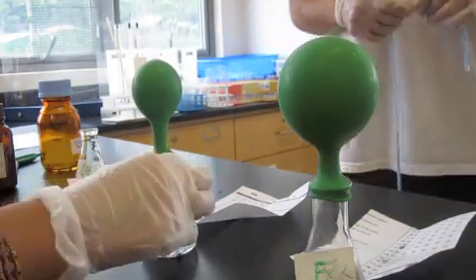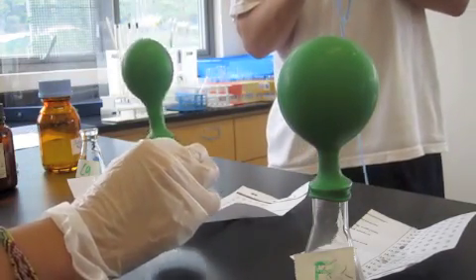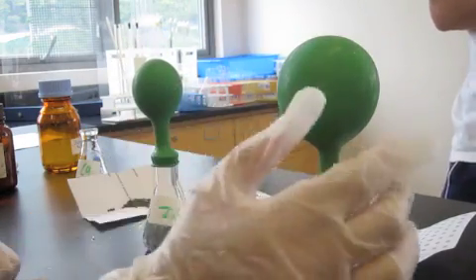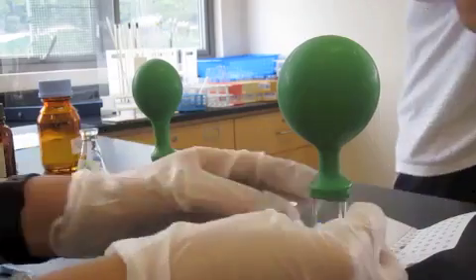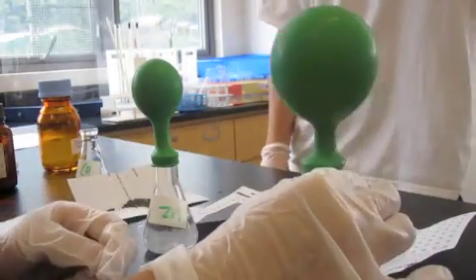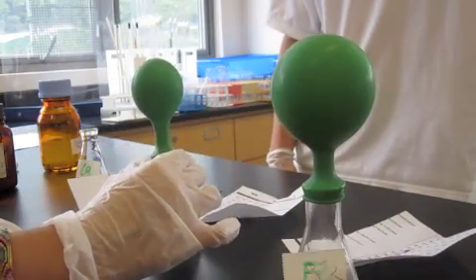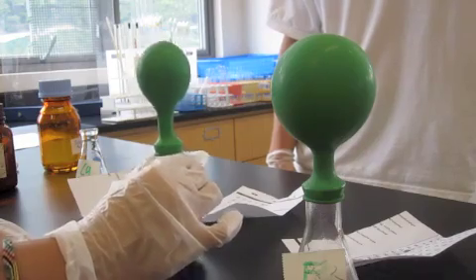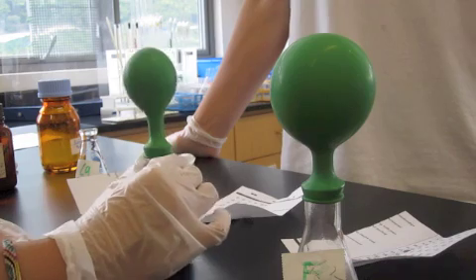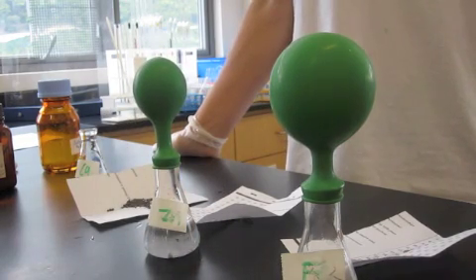We first set our intervals at 30 seconds, 60 seconds, and 90 seconds. However, we found out that the balloon didn't inflate as fast as we thought it would. So we changed our times to 2 minutes, 4 minutes, 6 minutes, and 8 minutes. We also wanted to find the long run of the balloon, so we also calculated the balloon at 30 minutes. The way we calculated the balloon was by placing a string around the balloon to measure the circumference of it.